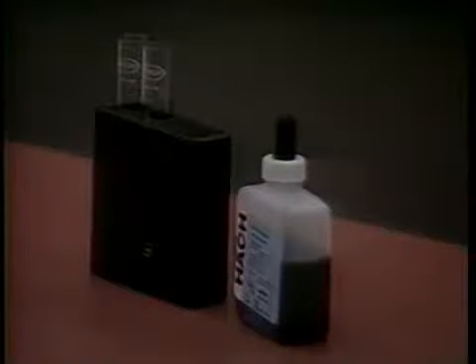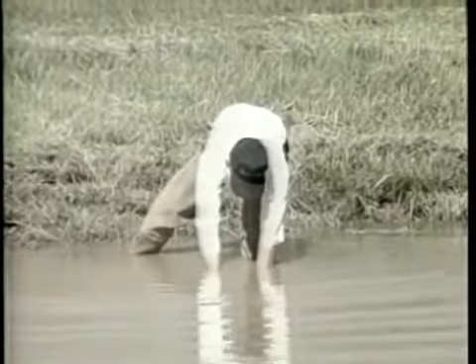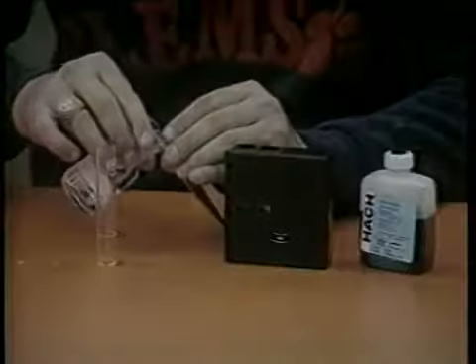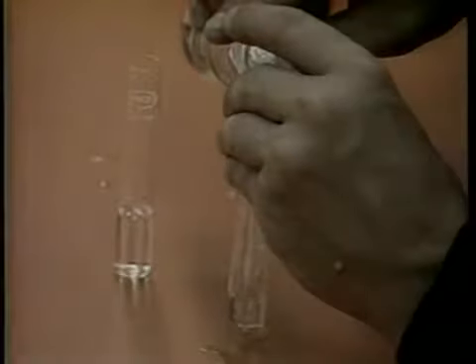There are two methods to measure pH, by kit and by meter. As with dissolved oxygen determination, the kit method is less expensive and therefore more practical for pond owners. To test the pH using the test kit method, proceed as follows. Obtain a water sample away from the pond bank in a clean jar or bottle. Rinse the 2 color viewing tubes with the sample water. Fill each to the 5 ml mark.